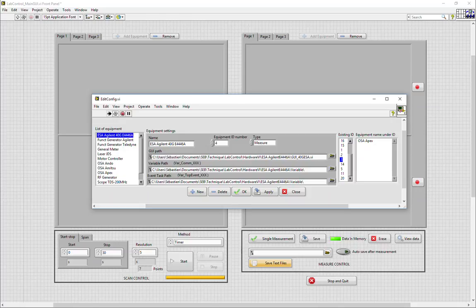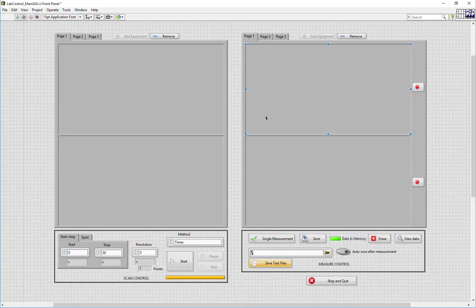Now the other VI that is required for every equipment is the event task. This is a VI that is used to transfer tasks from the main lab equipment GUI to the equipment VI. You can select each of those three for every equipment and then simply either apply or click OK. OK will automatically stop the execution of the edit config as well. If you click close, no change will be applied unless you previously clicked apply. New equipment can be added as well as deleted. If you selected bad files, you will be notified.